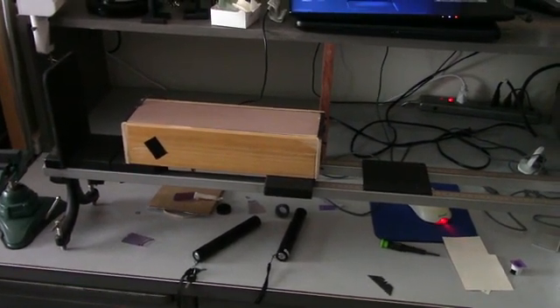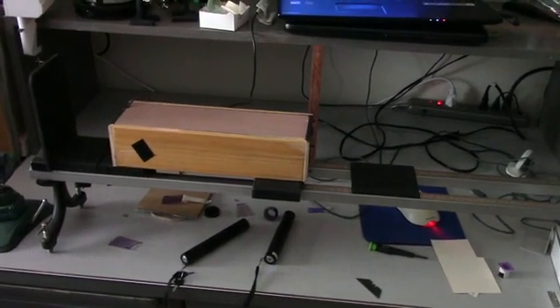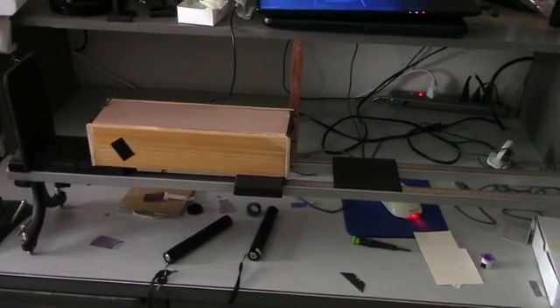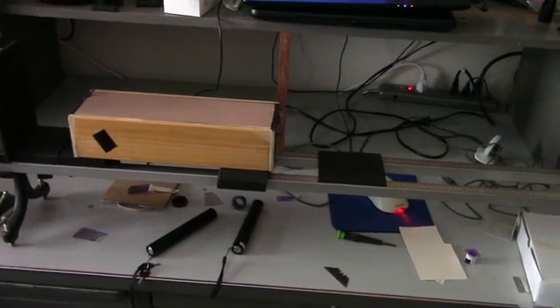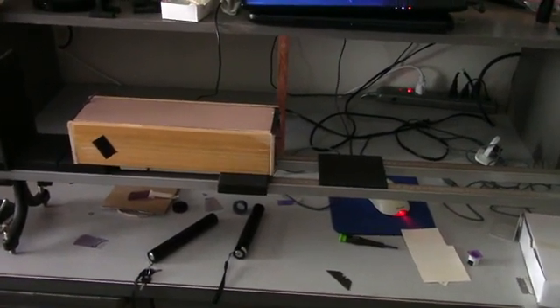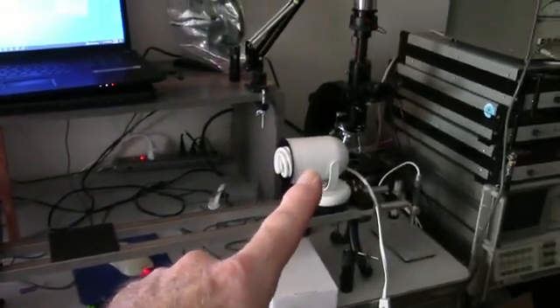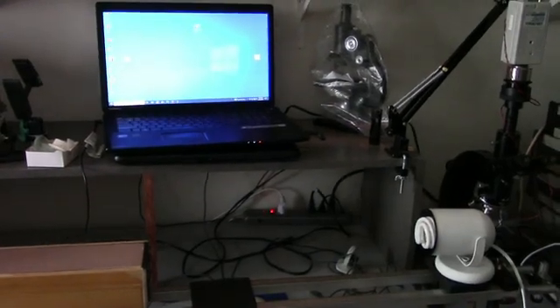Well, this is one more tool that you can build yourself that will give you more information when you're experimenting with optoelectronics. So go on the internet and check out Theremino Spectrometer, and you'll get quite a few hits. The software is freeware, so hats off to the fellow that designed this stuff. Using this device, you can calibrate it with a compact fluorescent light to get your points, and then on the screen you get your display.